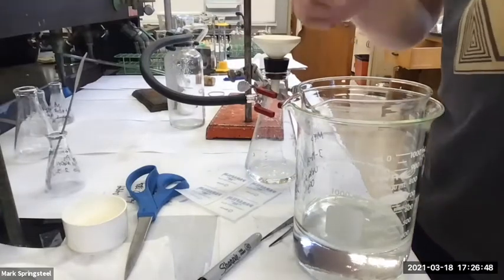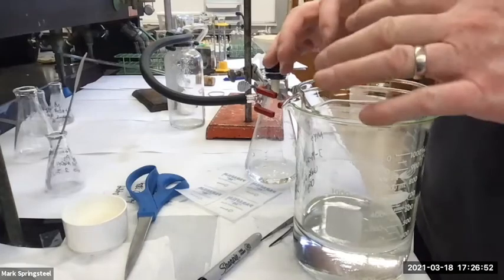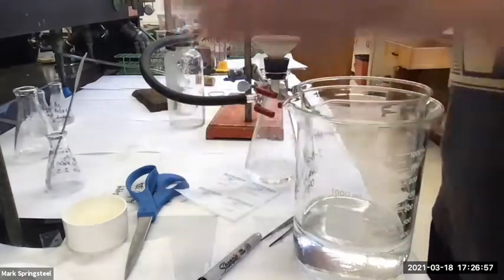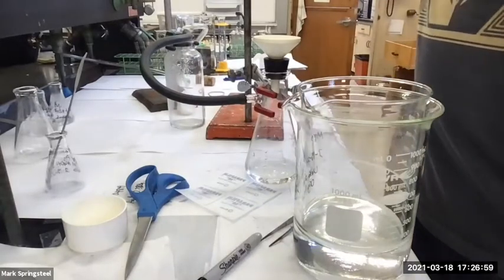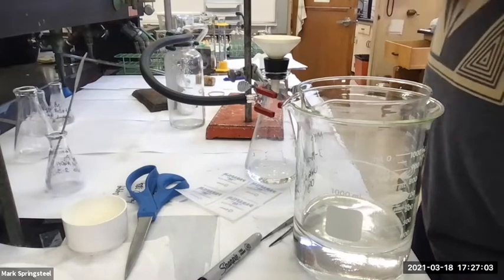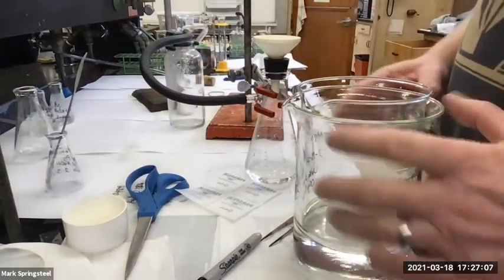benzoic acid. Actually, this is the impure neutral compound because it has the dibromobenzene. And then I'm going to take this impure solid, do a crystallization, get that by itself pure, get its mass again, and then I'm going to take an IR and NMR, and we'll figure out what they are. All right, now it's just time to clean up. Actually, I'll show you a little bit of that.